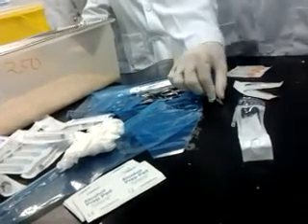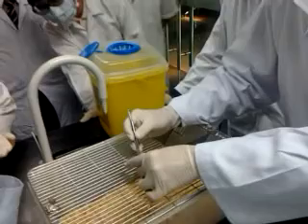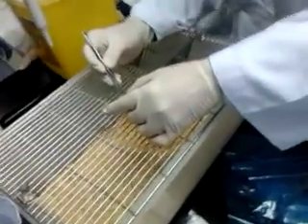And you must have a forceps. Do you have a forceps? Okay, thank you. Non-tooth forceps. Tooth forceps is very sharp, so use a non-tooth forceps. Once in this position, you must pull the tongue to the side. Don't press, don't pinch the tongue too hard, just hold on to it.